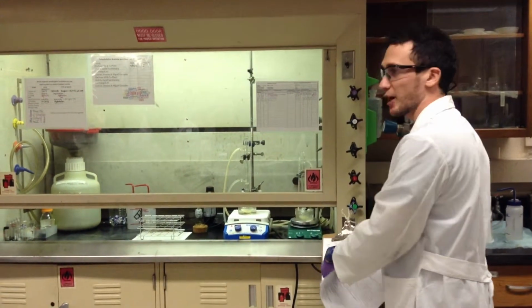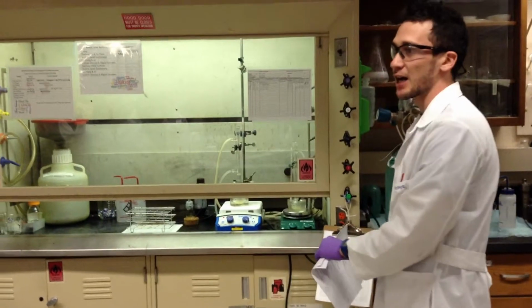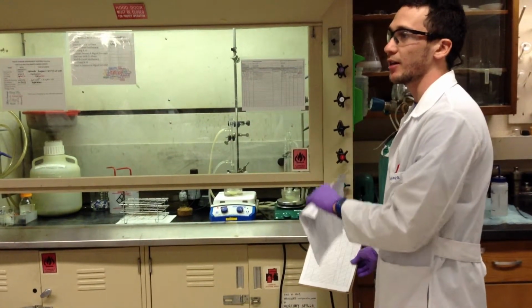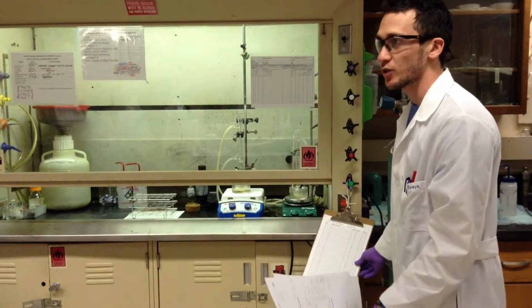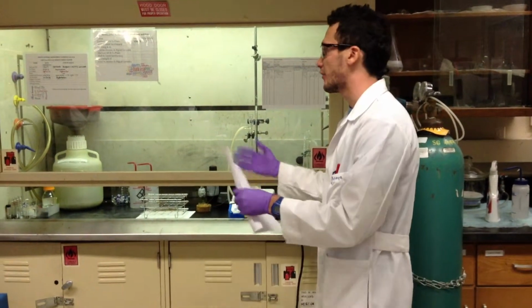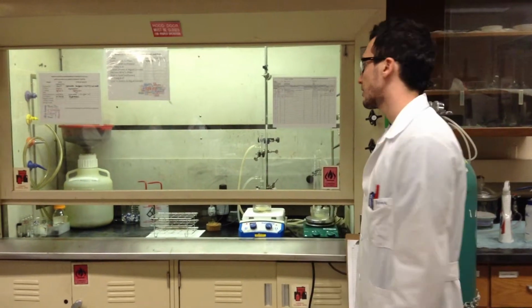That way, we can check if someone is disposing of, like, acids with hydrocarbons, so we can talk to them. But please, guys, we need to actually write down what we are putting in the bottle. Because if we don't, first it's going to be harder to treat, and it's going to be more expensive to treat. And then the lab coordinator or the person in charge of delivering that bottle has to go talk to us and say, hey, I don't know what is in here. I know what a third of it is. I know what it is, but the rest I don't know.